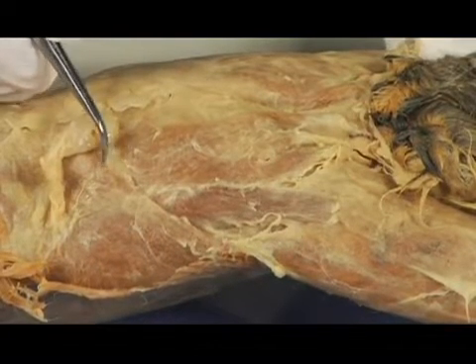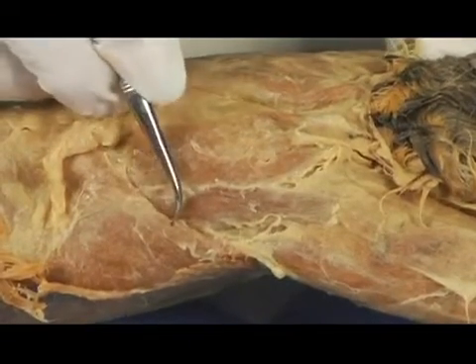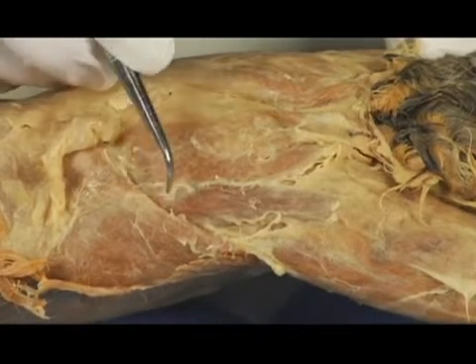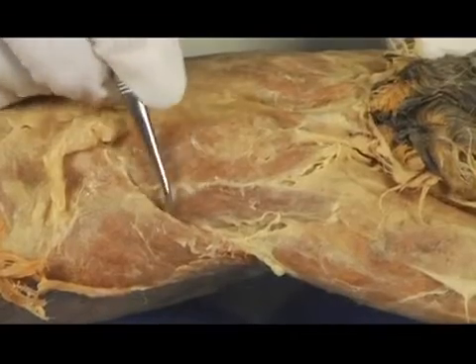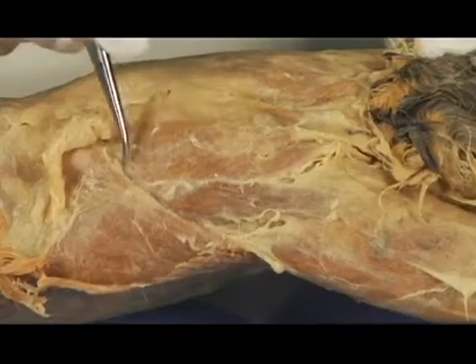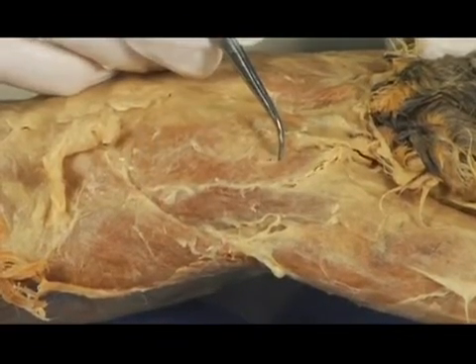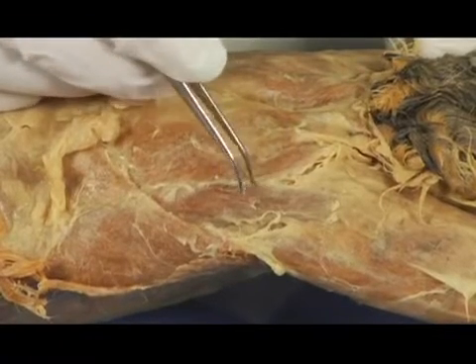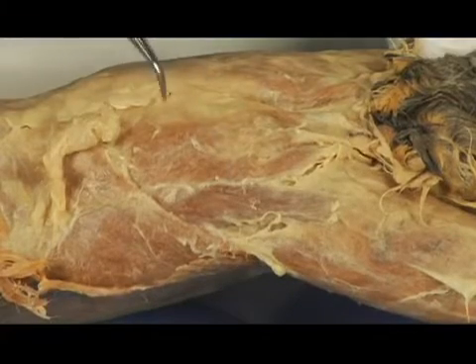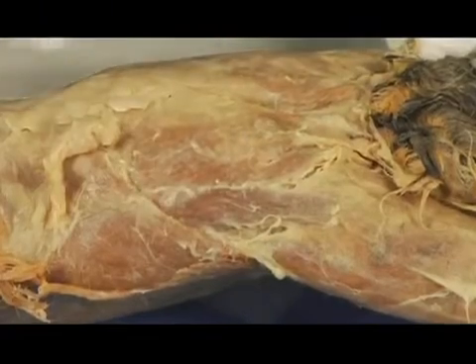So the latissimus dorsi, which you might be familiar with from your own body if you've done any weightlifting or anything like that, it's a large, powerful back muscle, is right here. And this is defined pretty much by this little border that I'm moving my probe along this area here. So we've got the latissimus dorsi, the levator scapulae ventralis, and the, what was it? The spinodeltoid, which is this one right here. So we've got those three muscles pretty well exposed.